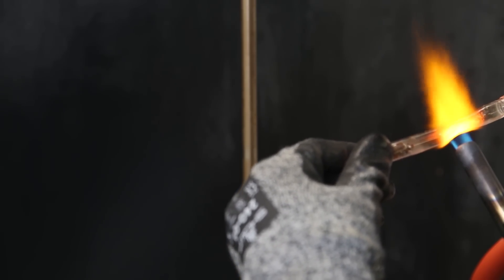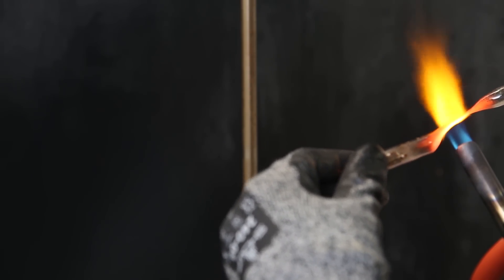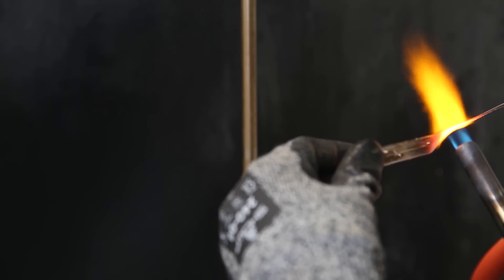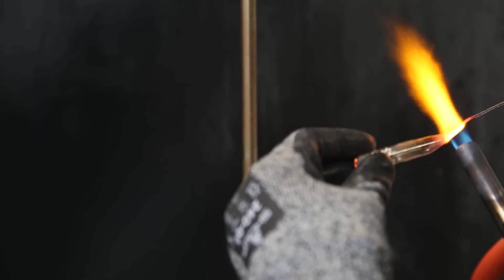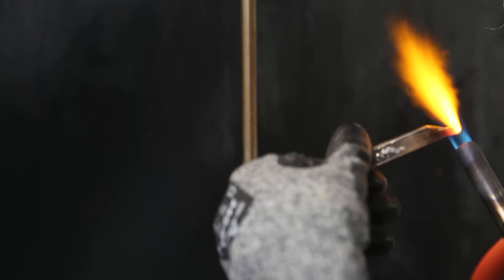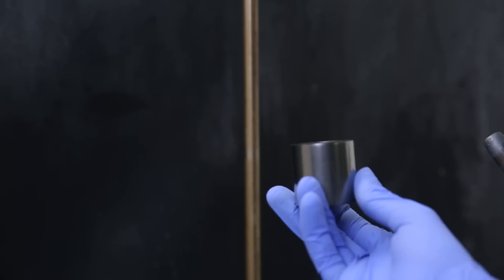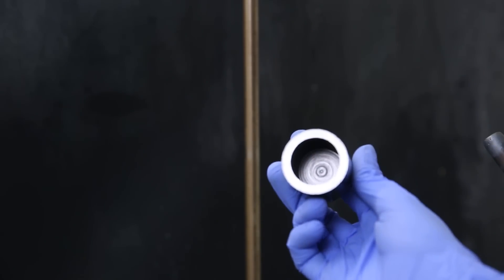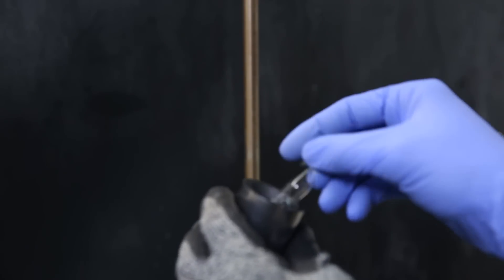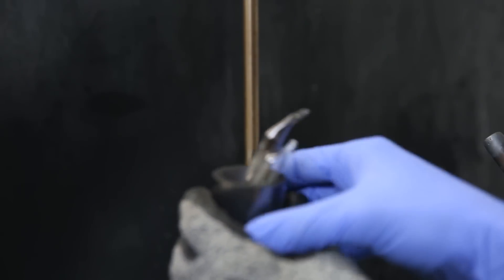I'm not completely sure at which temperature this reaction takes place, probably at quite low temperatures already. But the high temperatures are necessary to melt the uranium and collect it into a bead. Otherwise, it will just be a complete mess. I then use a crucible like this, or any other, and put in one or two tubes together. The glass will soften and collapse a bit under the heat, but it will not melt, and so it will contain all the materials without exposure to the air from outside.